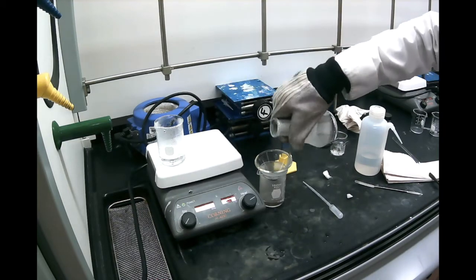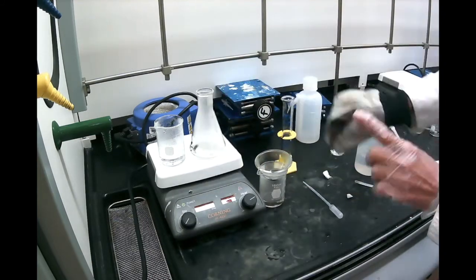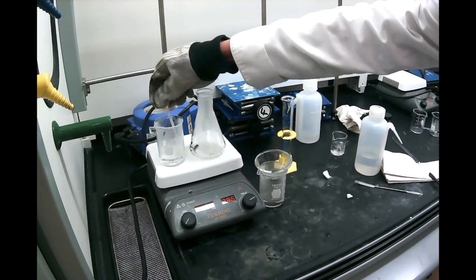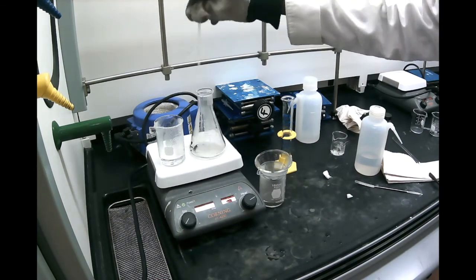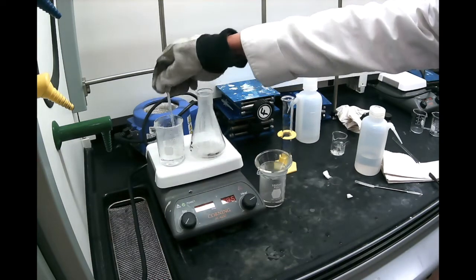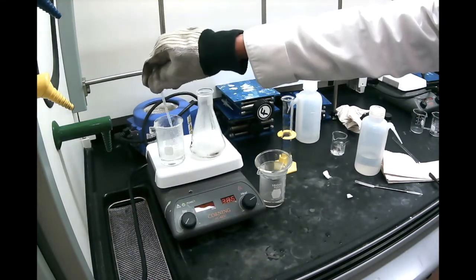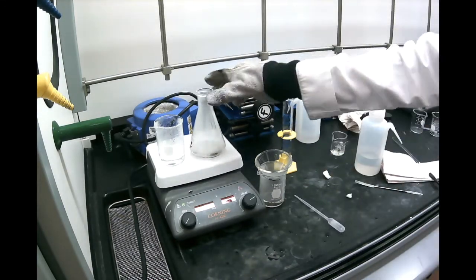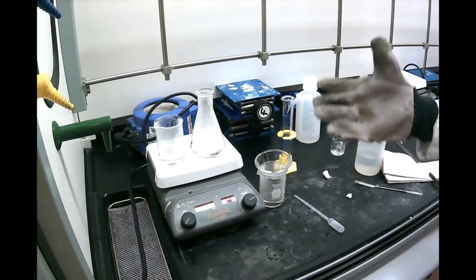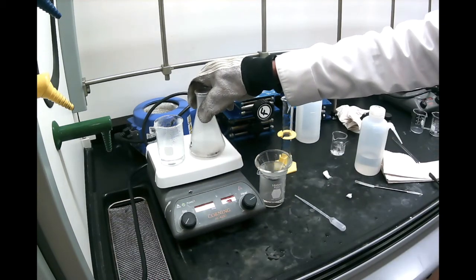And now I'm almost done, so I transferred everything. The last step is to rinse your flask with some hot water. And why? Because we really want to have the maximum recovery here. We want to recover as much of the crystals as we can. And as you can see, every time I add water, it has to be hot, and it has to keep on heating, because if it cools off, the crystals will recrystallize immediately.